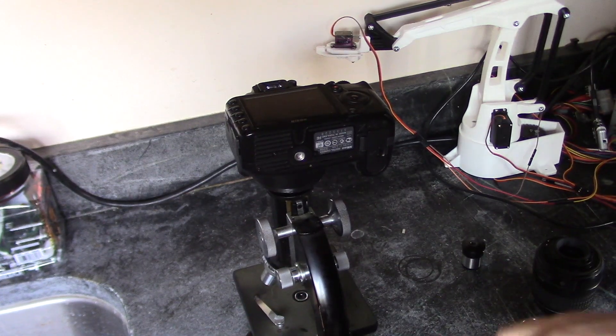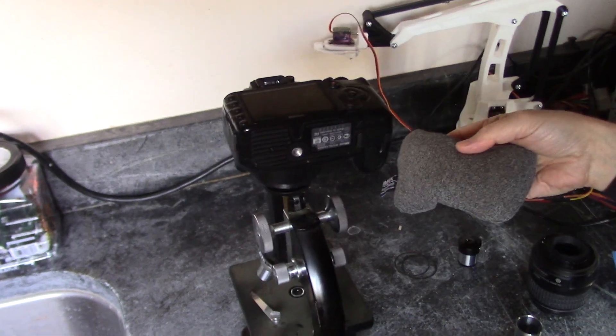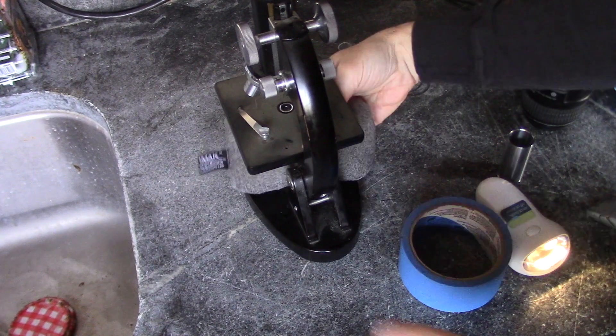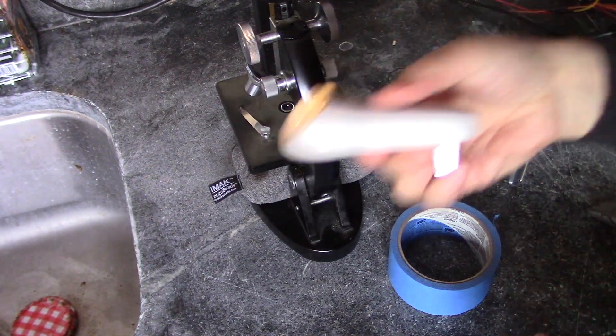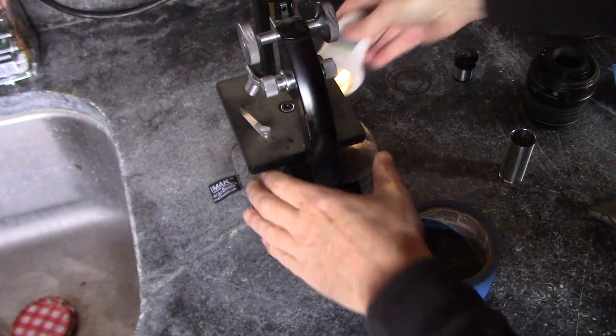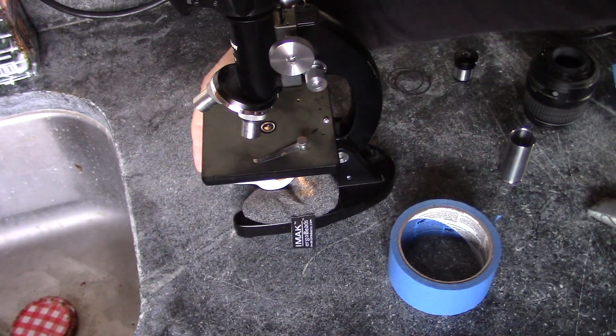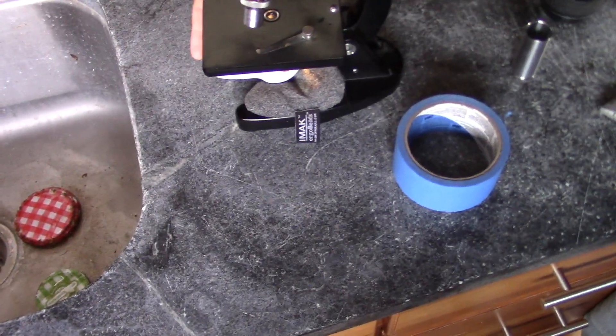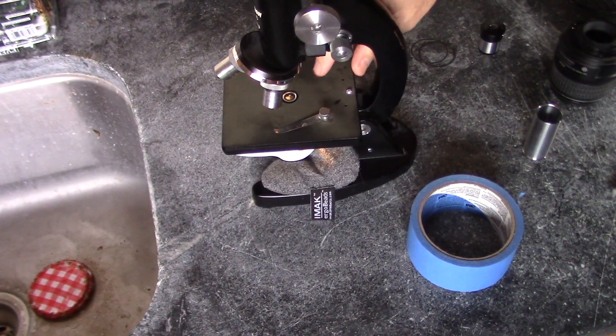Okay, so as I mentioned, I don't have a light. So I've got this wrist cushion, and I'm just going to put this down here like this. I know that seems odd, but then I've got this LED light that just plugs into an outlet. And now you can see that I've got light shining through down there, okay.